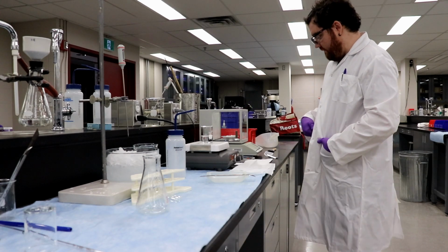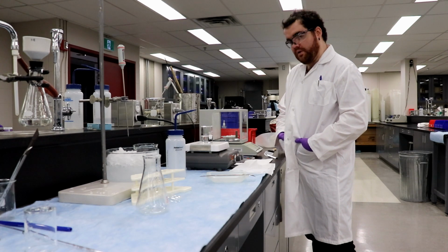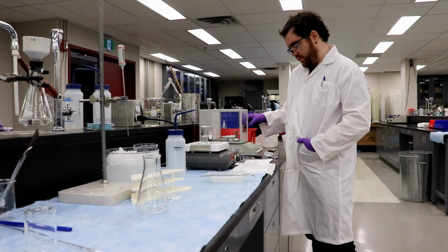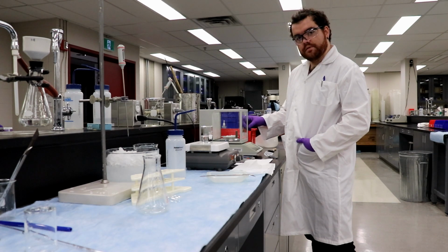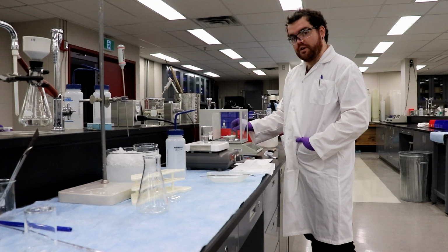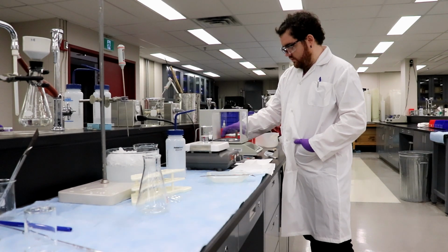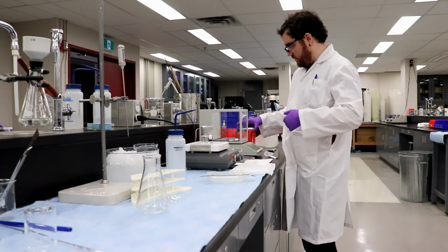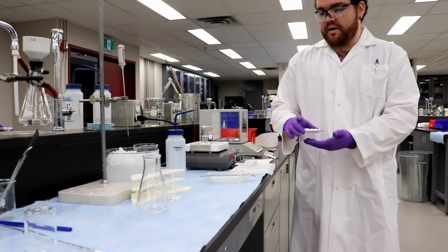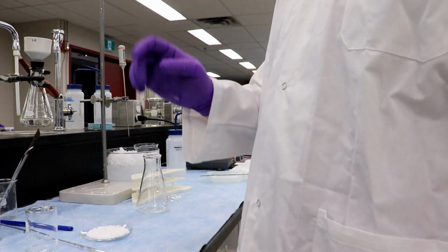Okay, so Ingrid, we are at 56.4420. Correct. And it was 59.4450. So we lost about 3 grams of water. Yep, and I calculated the theoretical mass, and it's about 6.4. So our theoretical mass is 6.4 grams. And what's our current crude mass?